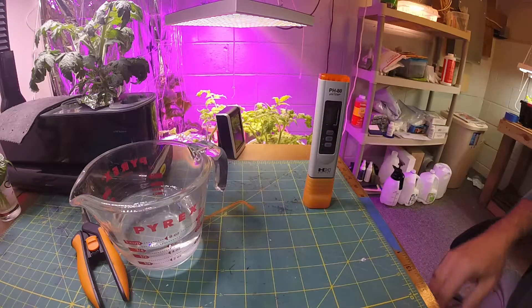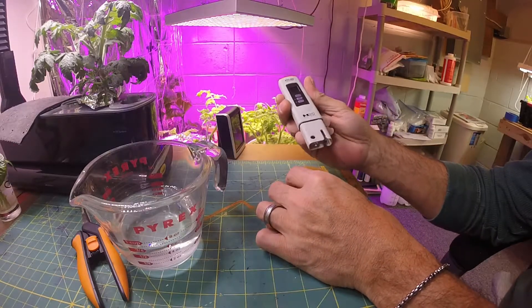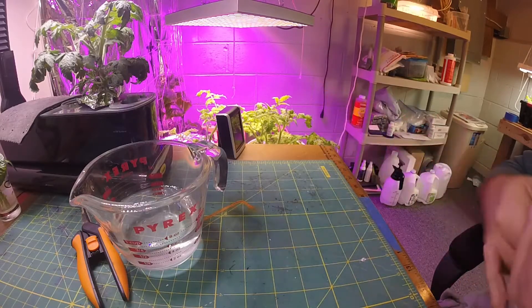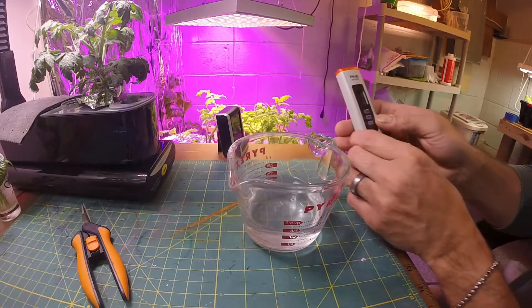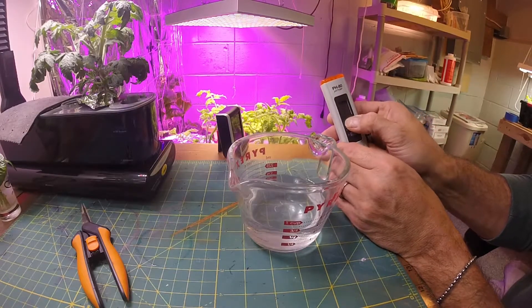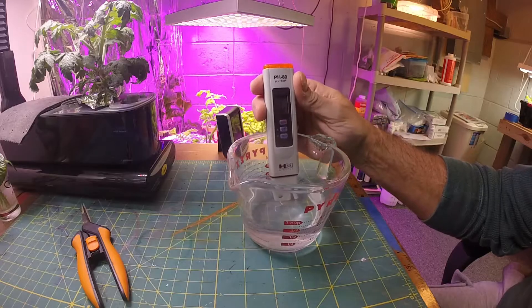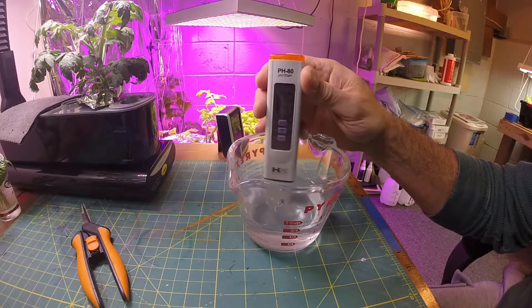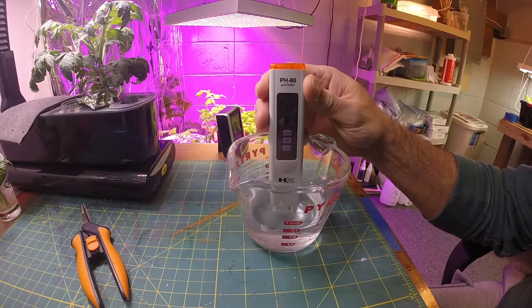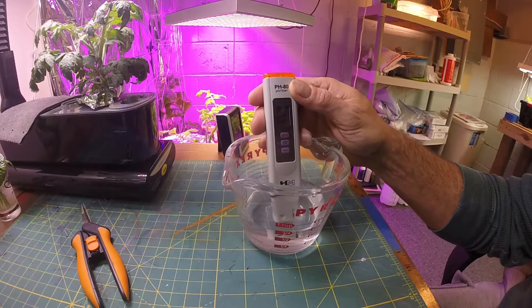Okay, so it's been about 15 minutes. I'm going to take this out now. What I did was I got some tap water just to see - this is straight out of the tap. What I'm going to do now is basically just press power and enter, and it comes up to pH. We're going to put that in the water. Now my water should be around seven, maybe a little bit higher than seven. It's reading and it's saying it's 8.3.